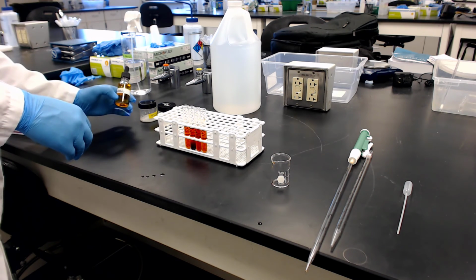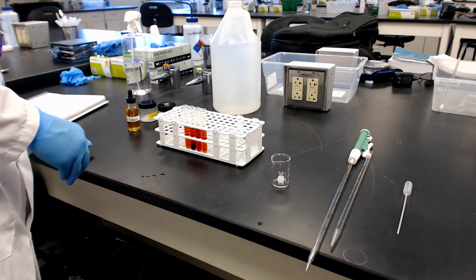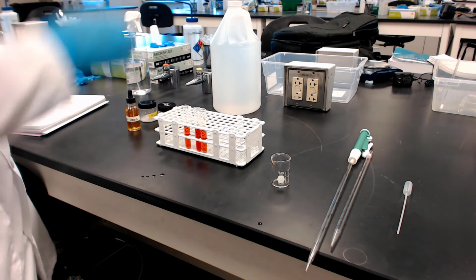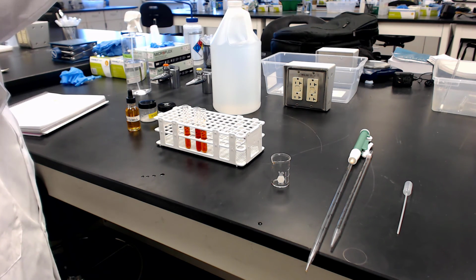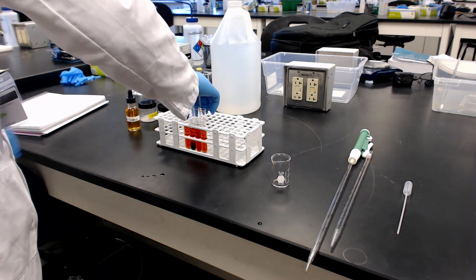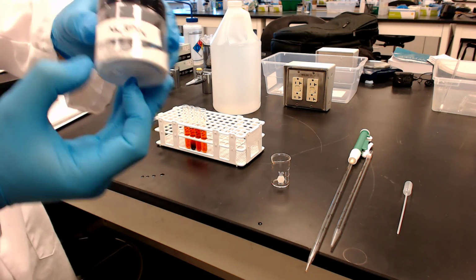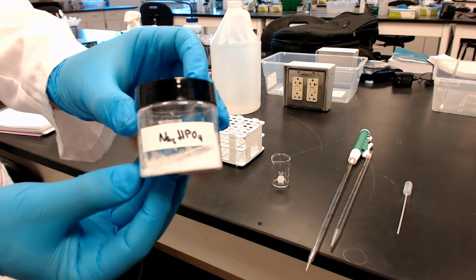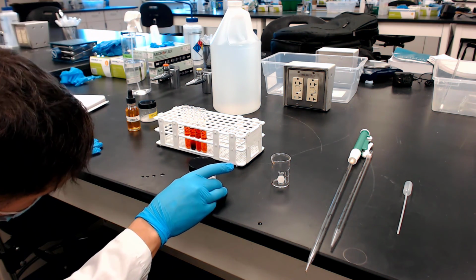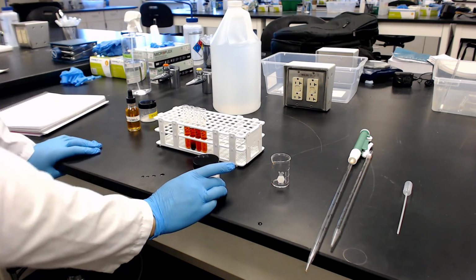Finally, we're ready to add the sodium hydrogen phosphate, which is step 5. Now remember that the hydrogen phosphate is actually something that's able to complex with iron 3+. It makes a clear complex, but the point is, as we study these reactions, it would be removing iron 3+, one of the reactants, from the equilibrium. So it's going to adjust accordingly.